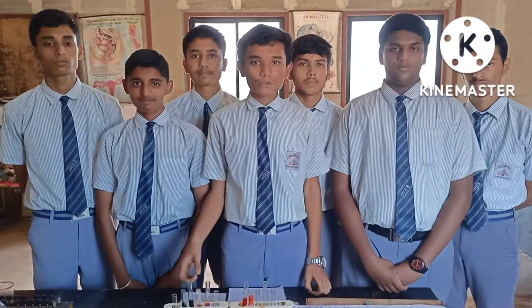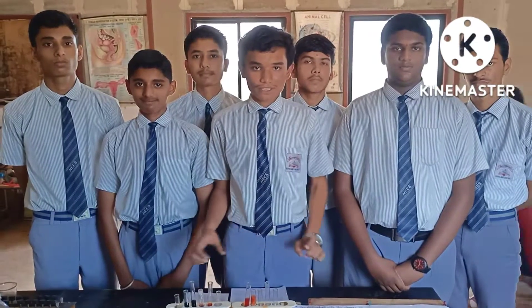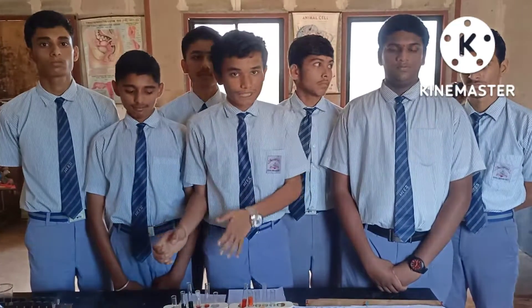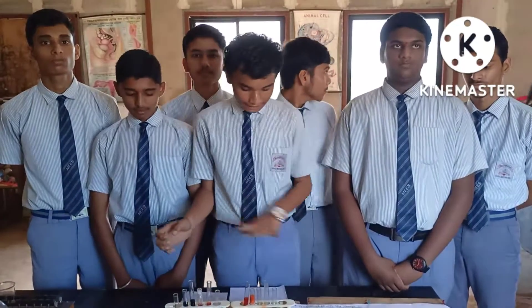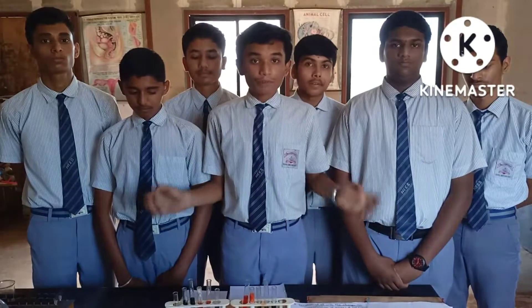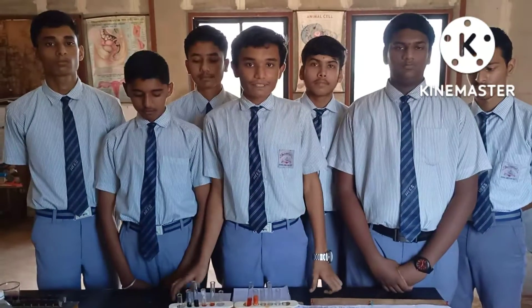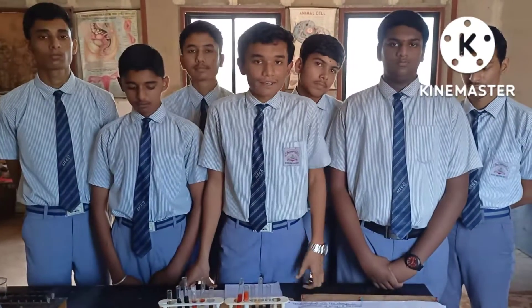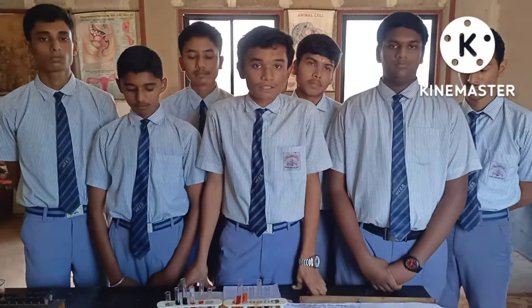The aim of this activity is to know the pH of following substances through the pH paper and indicators. Before we start the activity, in general, what is acid, base, or salt?